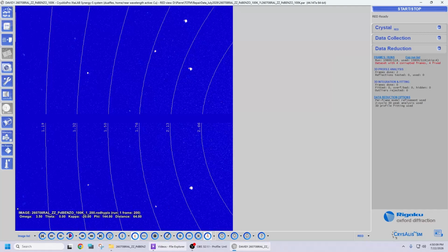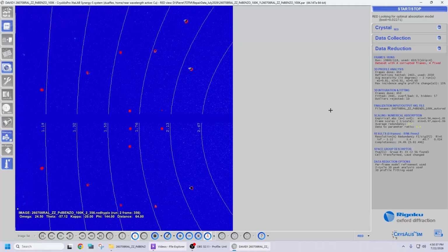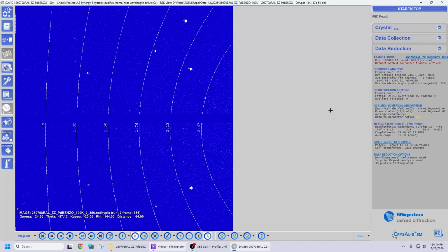So let me first play them as a movie, once again by pushing the movie button at the bottom of the CrysAlisᴾʳᵒ interface. And you see that CrysAlisᴾʳᵒ went through all the images just fine without stopping at any one of them. In the same vein, I can now reduce the dataset by going to data reduction and selecting automatic data reduction with current cell. And once again, CrysAlisᴾʳᵒ can go through the entirety of the 2 scans without stopping. And you can see on the right-hand side here the scaling statistics that stem from these 2 scans.